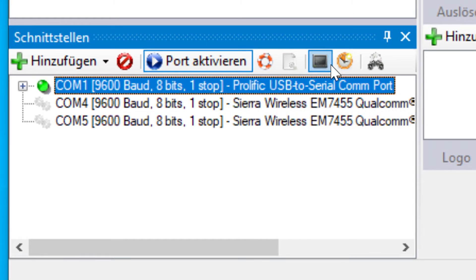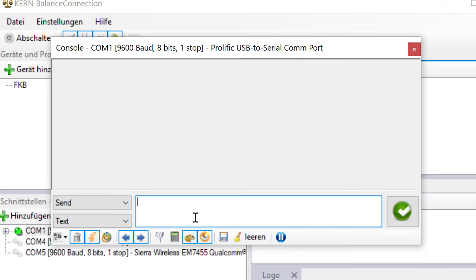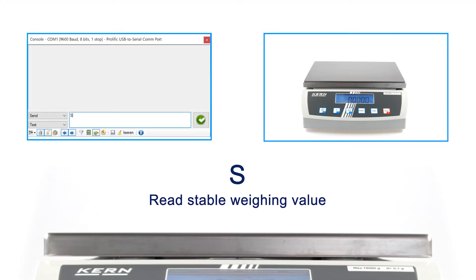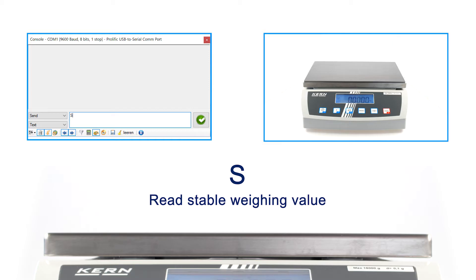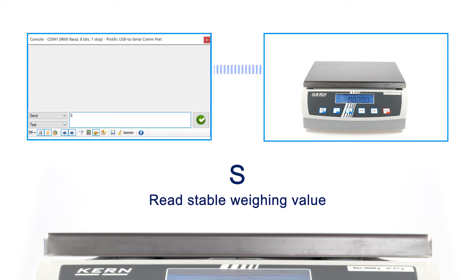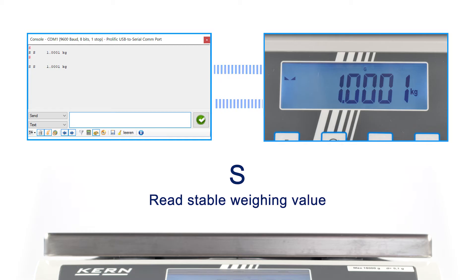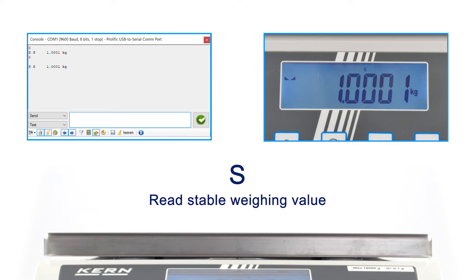Now you can start the communication with the scale by sending specific commands. By using the command S, a stable weighing value can be requested in the KCP protocol. This remote control command can be sent to the scale as soon as a weight has been placed on the weighing platform. The scale transmits the next stable value to the computer as soon as, and only when, a stable weighing indication has been reached.